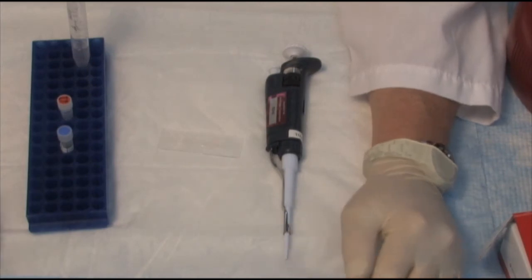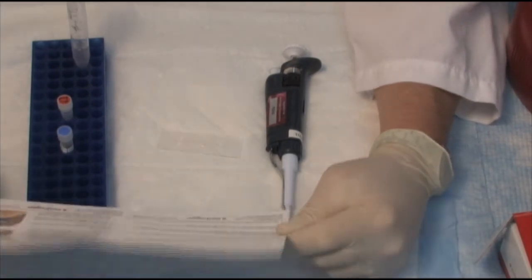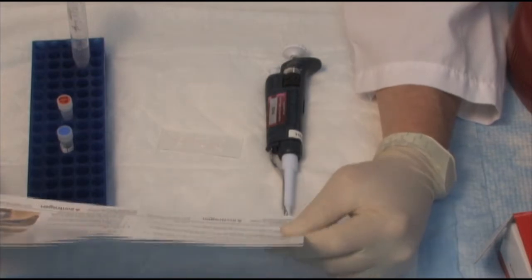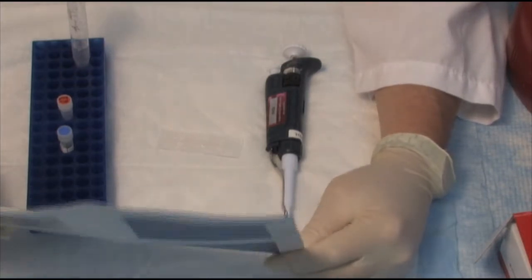Following the quick reference guide, we're going to load 10 microliters of our sample to 10 microliters of the Trypan Blue.